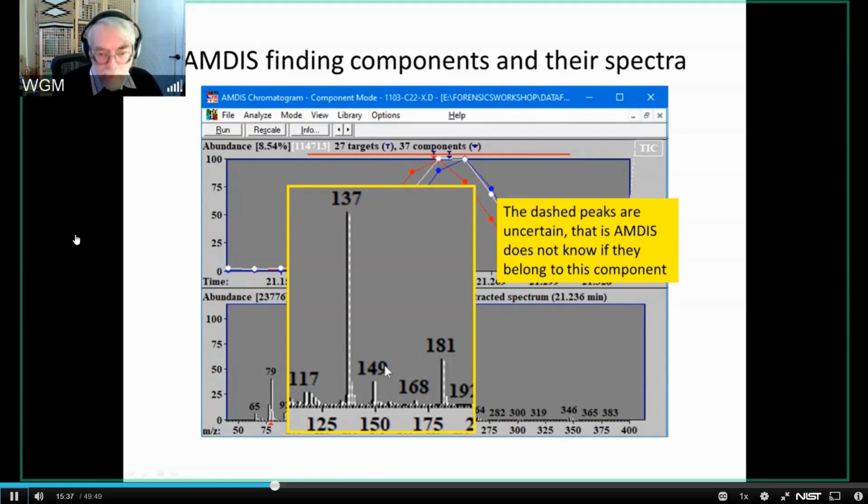So, you have the option, by the way, and I'll show you in a minute how that looks. You have the option of just not showing the uncertain peaks at all. So this is sort of the default. The uncertain peaks are dashed, which at times can be hard to tell. But basically what this is telling you is that there are ions here that are hard to sort out.